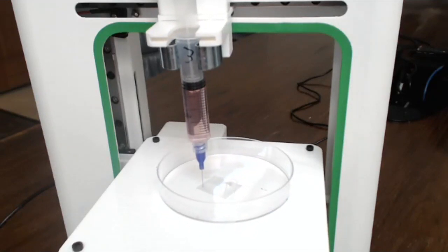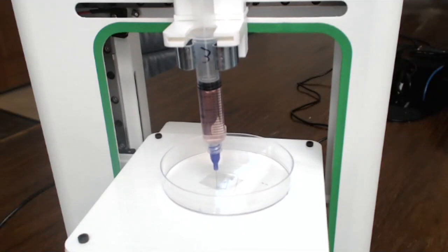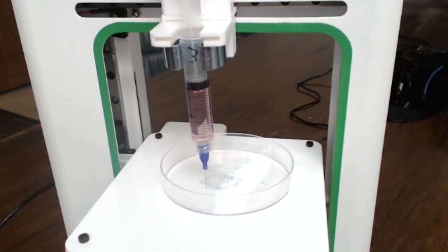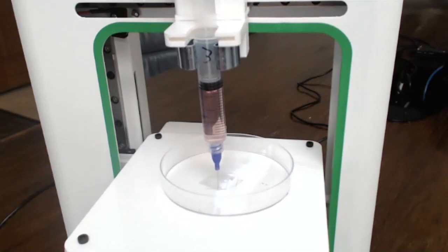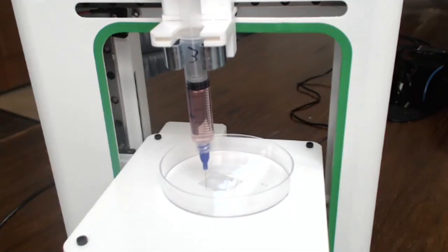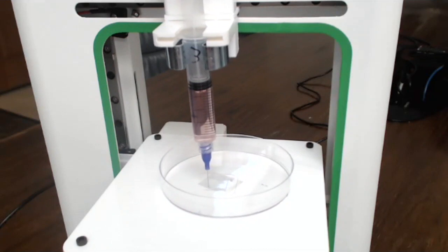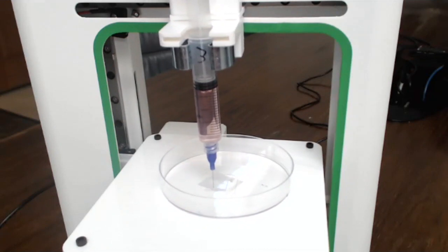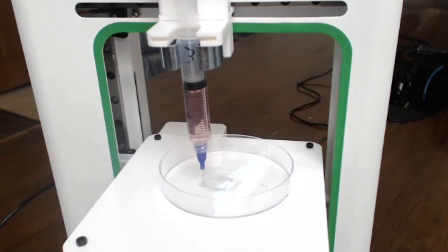Yes, so there's also a question about the paper test. We typically slide a piece of paper underneath it before we begin a print. That is using the paper as a way to set the Z0 position. So you want to start at a Z0 position, which is paper thin. It's the traditional 3D printing method of zeroing the Z height.